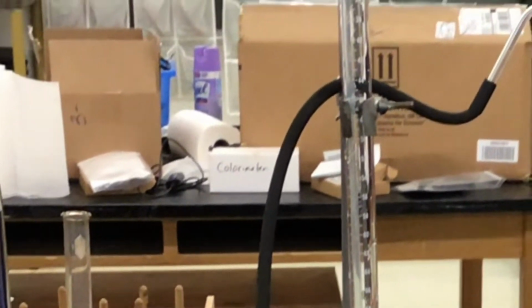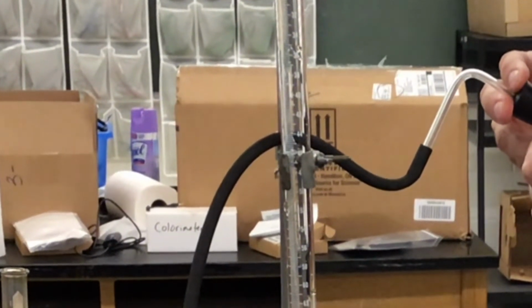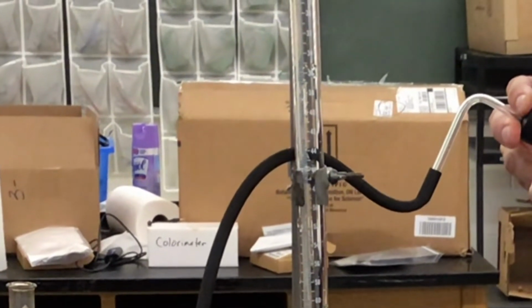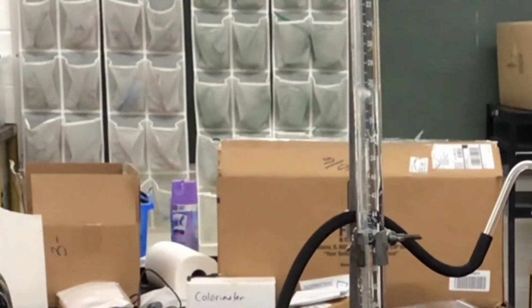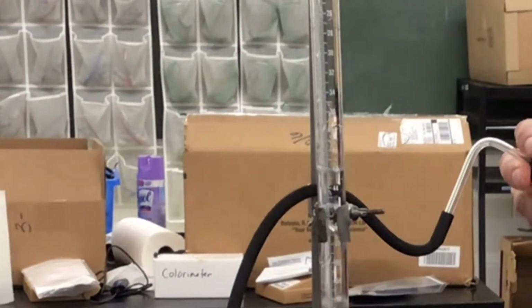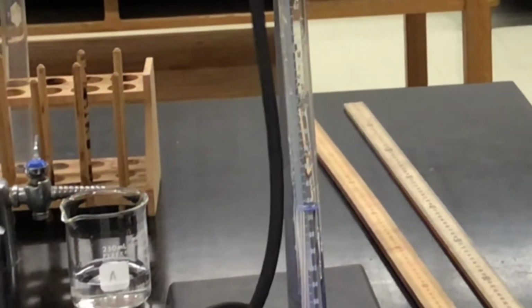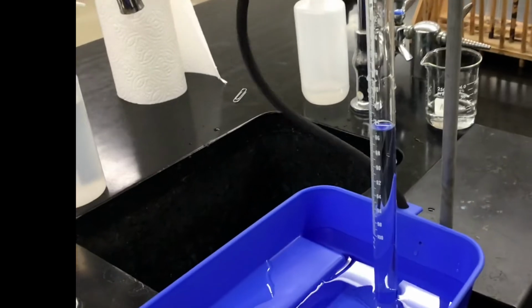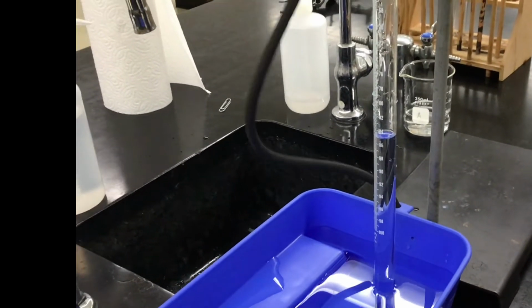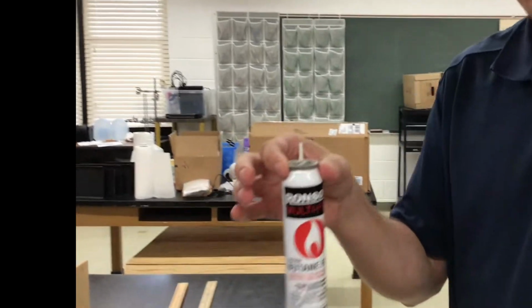So hopefully this is not going to have bubble trouble. I lost some bubbles, dang it. There's a couple of bubbles leave. I did not go past 90, did I? Okay, it's going to read over here. It's like 80 something. So I'm going to do a little bit more. No, I'm not going to tempt fate. I think I'm going to stop there. So if this mass is about 0.2 something grams, then I did okay. If it's like 0.3 something grams, I sucked, and it's going to be too much error.